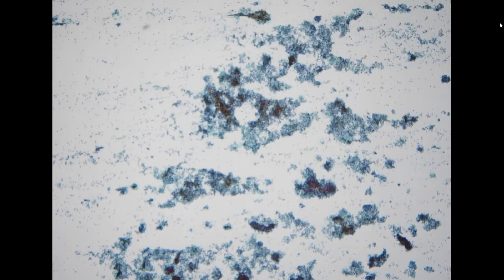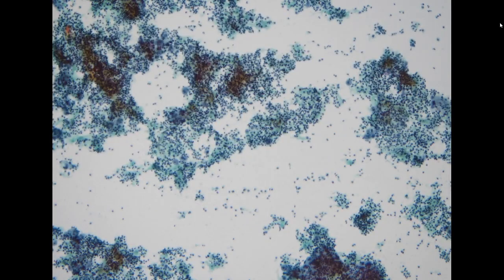So this is also from a patient with a past history of lung adenocarcinoma. And in this specimen, you can appreciate that the background is much more inflammatory than the prior. Sorry.